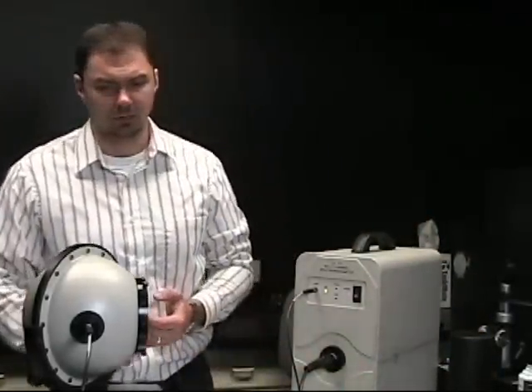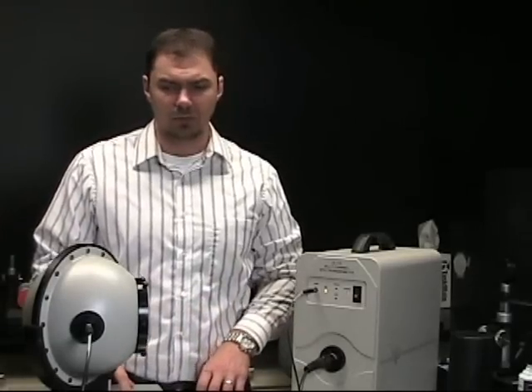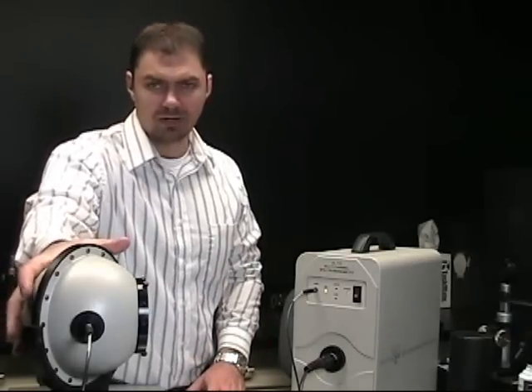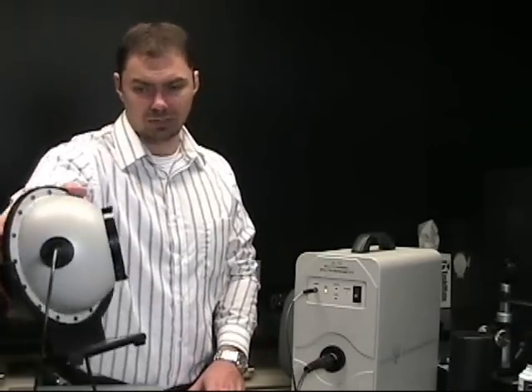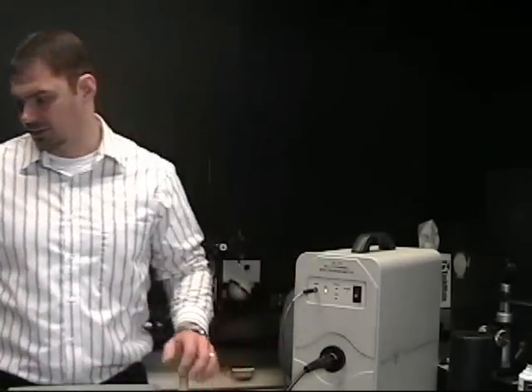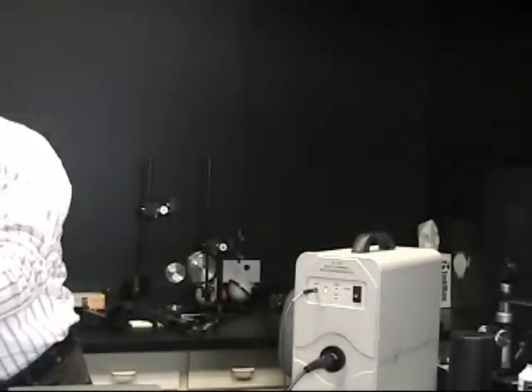Now that we've performed the total luminous flux and the radiant intensity measurements, we'll move into the radiance measurements of that same lamp. We do not use the six-inch sphere for this. Instead, what we're going to use is an imaging telescope.